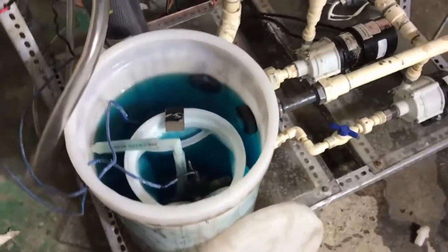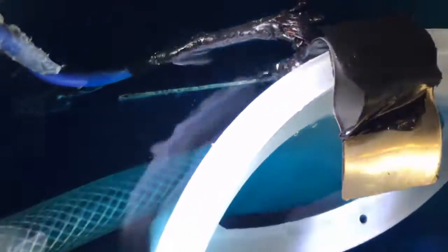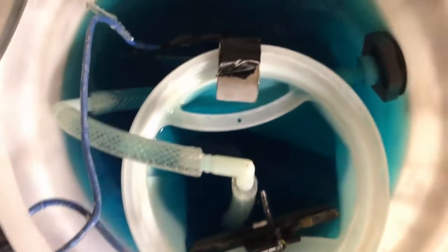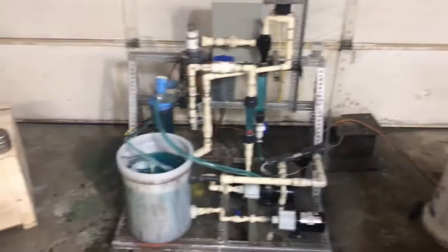I was worried about touching the anode bag, but it looks like we're clear. So I have moved the cathode closer to the anode. They're not completely straight with one another — I'm going to bend it in a second. But that did increase the amperage.